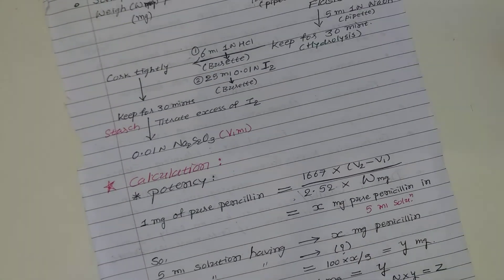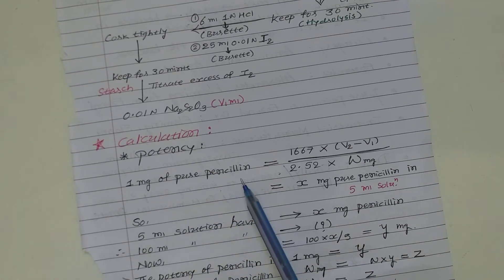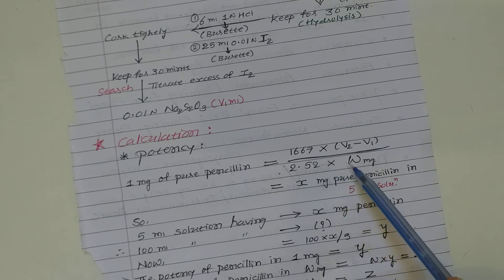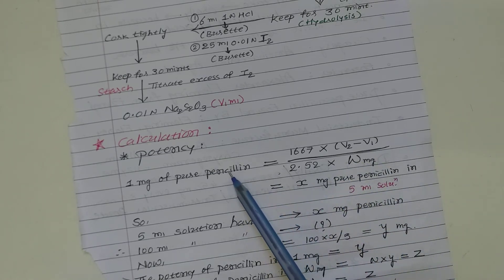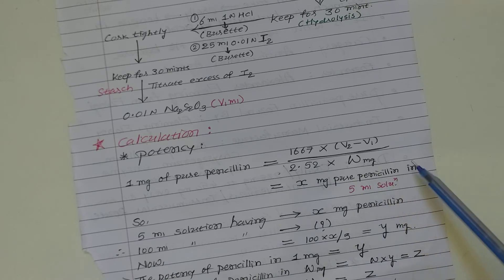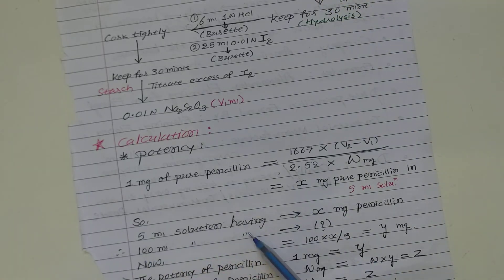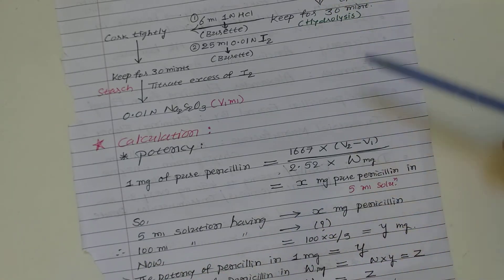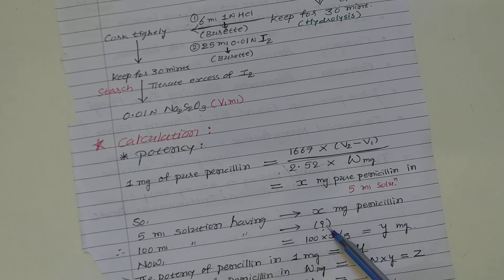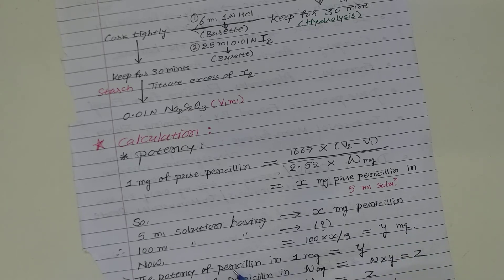Now, calculation of the potency of penicillin drug. The potency in 1 mg of pure penicillin is: 1667 × (V₂ − V₁) ÷ (2.52 factor × W mg). Suppose X mg of pure penicillin is present in 5 ml solution (since we already took 5 ml), so 5 ml solution has X mg potency. The total volume prepared was 100 ml, so 100 ml solution contains 100 × X / 5, which equals Y mg of penicillin. That is the potency in the total solution.